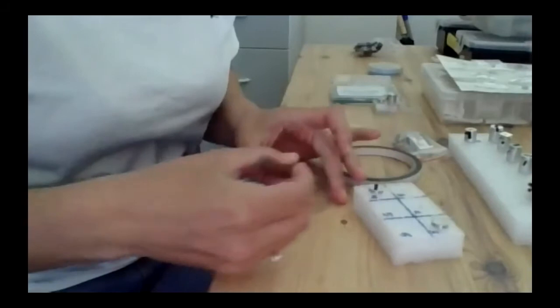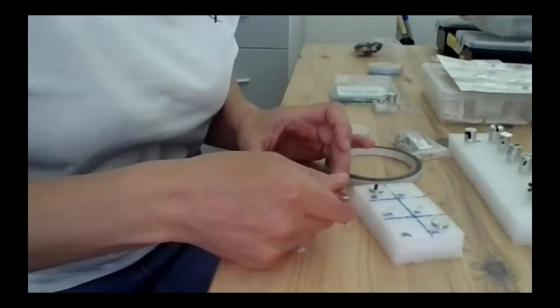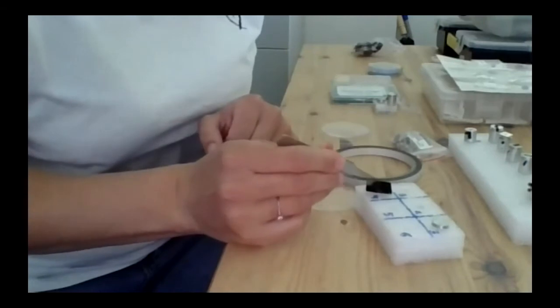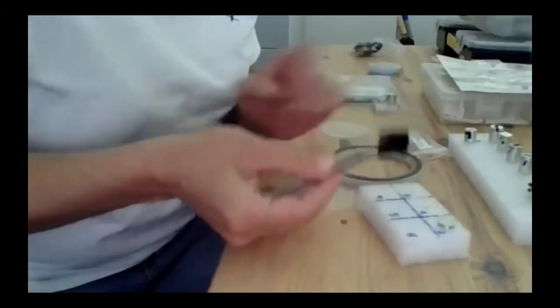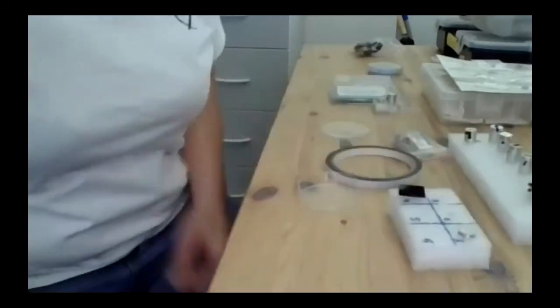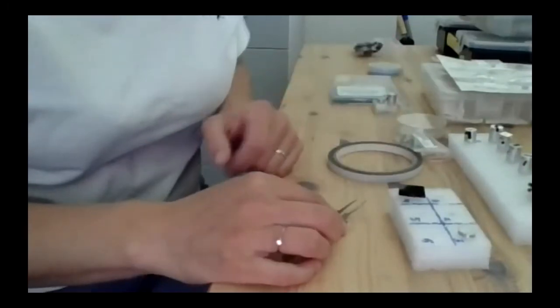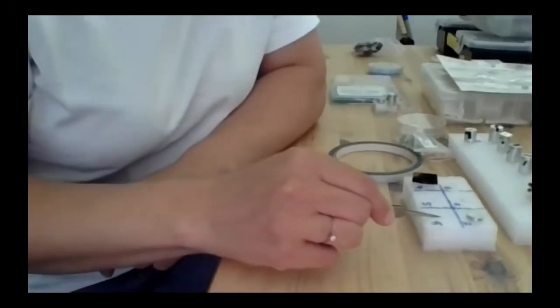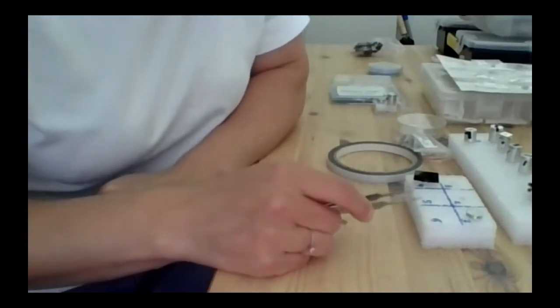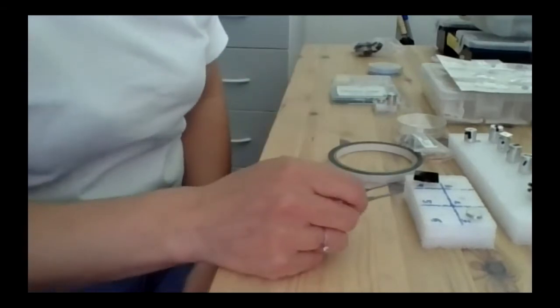So without any preparation, here is a thin layer sputtered by magnetron sputtering, and you just very simply place it there. Okay, fix it so that you are sure that it's not falling down. That's it. So preparation of samples for scanning electron microscope is very fast, and you can study whenever you want. Just you have to think about it, that it's better when it's conductive. We are also able to see non-conductive samples, but it's just a bit more tricky.